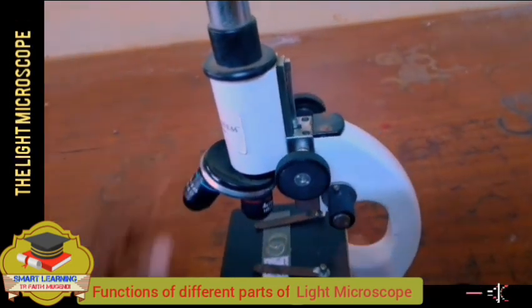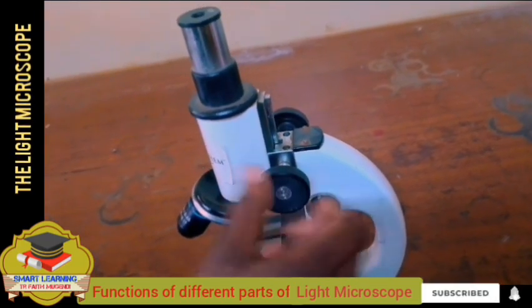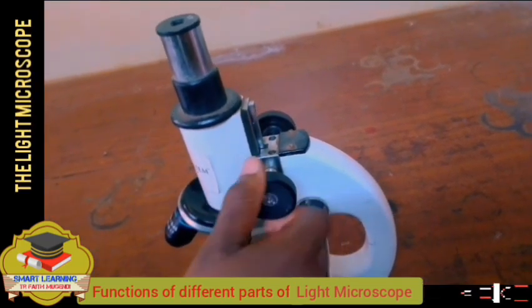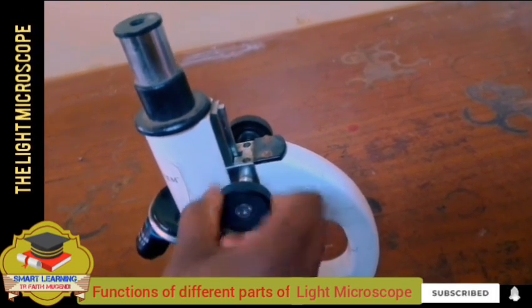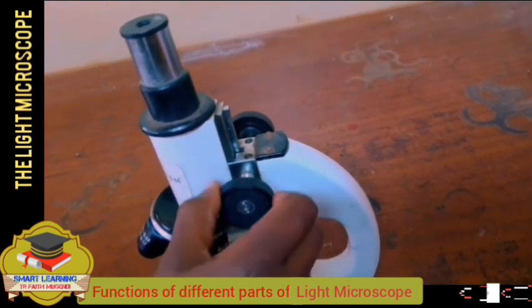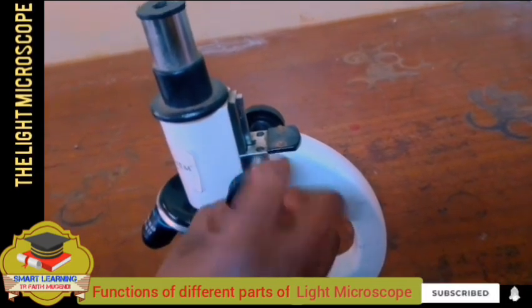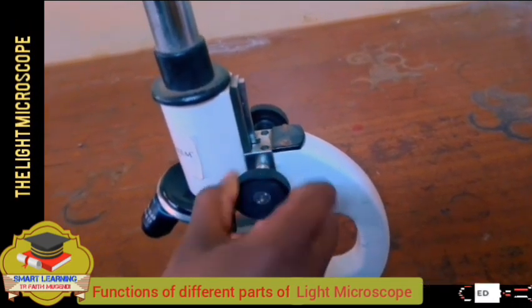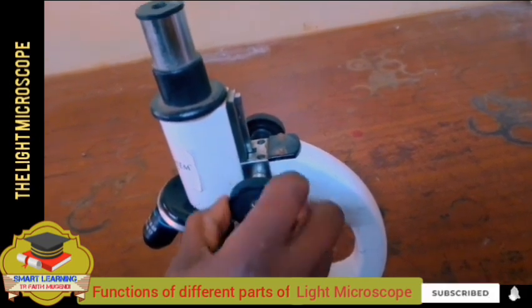Now, when you are using the coarse adjustment knob, you have realized that it moves the body tube to a larger extent, and the image formed by moving the coarse adjustment knob is not usually very clear.